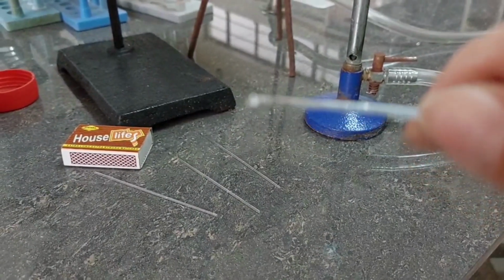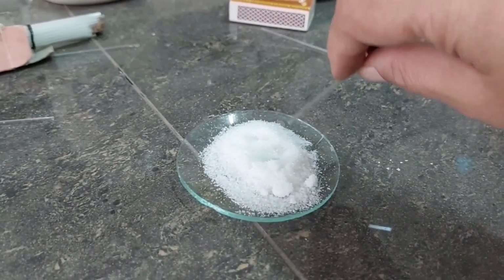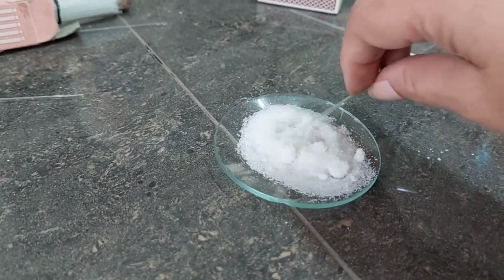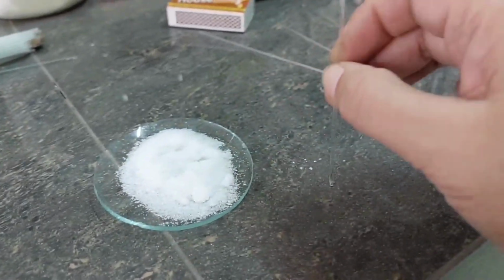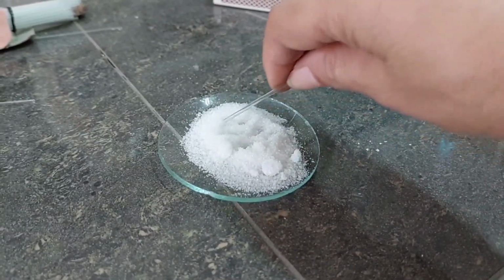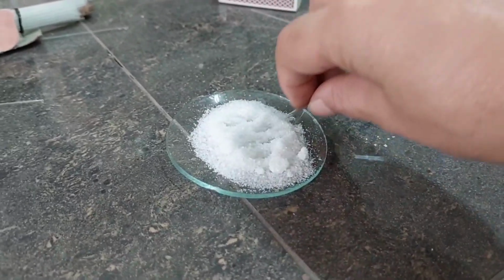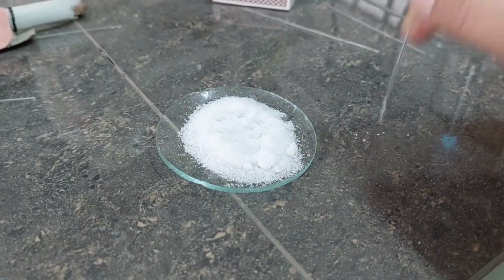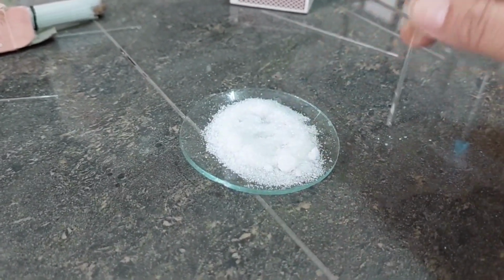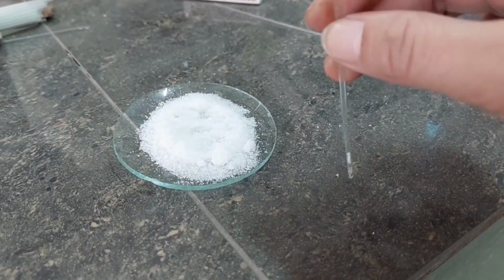So a bulb has been formed at one end, and now with the open end I am going to fill benzoic acid. For this, immerse it in this heap of benzoic acid and tap it gently. Again dip, immerse, and again tap. Make sure there is no air bubble. The compound is nicely and densely packed into this capillary tube. You can see the compound is going in the capillary tube, right?